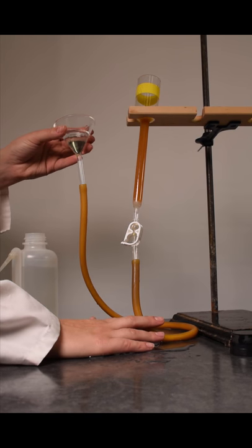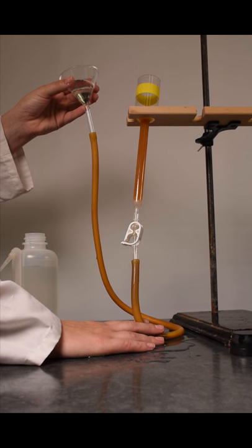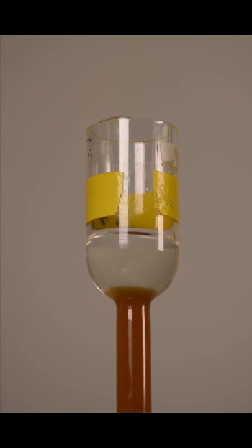Backwash the column by raising the funnel to force the water up the column from the bottom. Take care not to dislodge the glass wool plug or to lose resin during this operation.